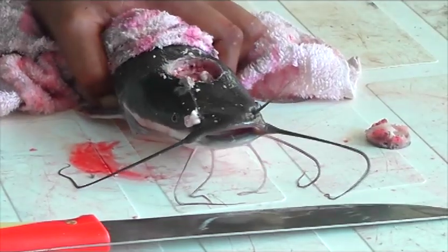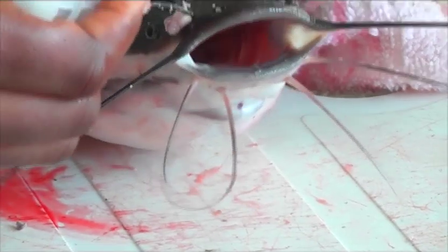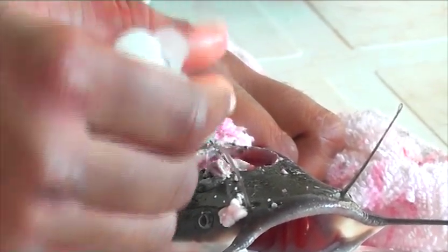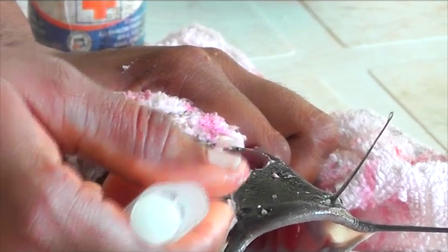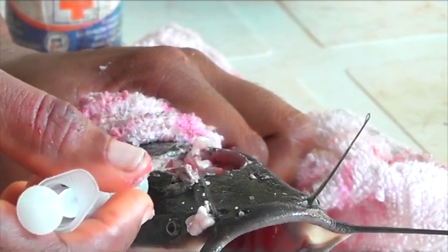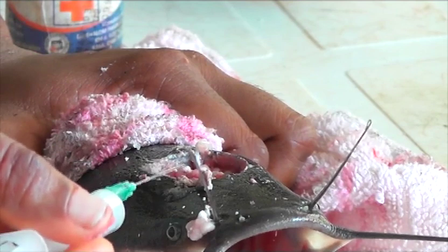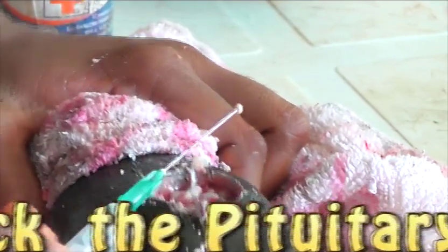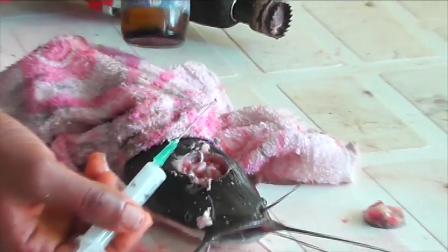Take your needle to pick out the pituitary gland. The pituitary gland is a tiny, rounded white tissue — very small, so it requires eagle eyes to identify it. That is the pituitary gland. The next thing is to put it in the methylated spirits for preservation.